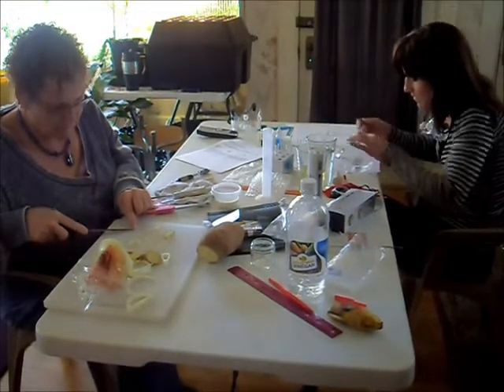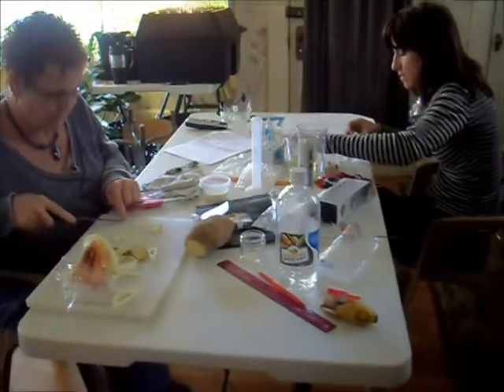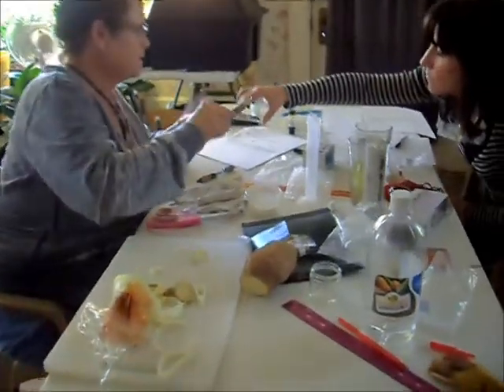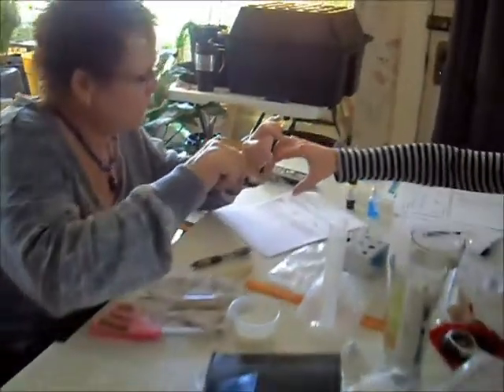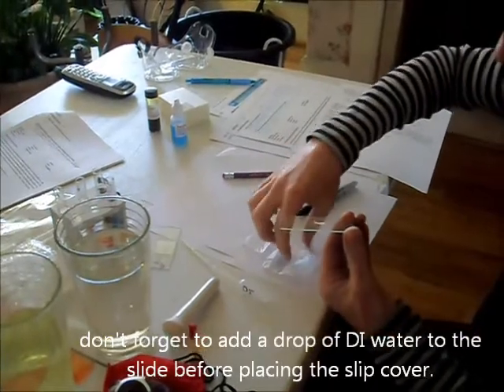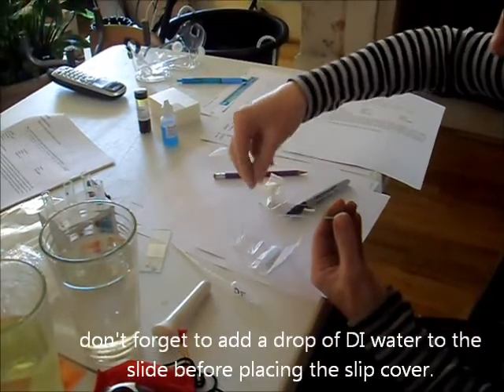Now Melanie and Cindy are working on test three, the starch test. We're taking out microscopes. Melanie is preparing a razor-thin layer of potato, and Cindy is putting it on the slide.